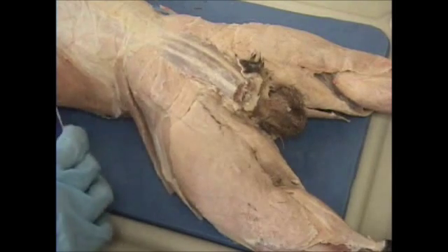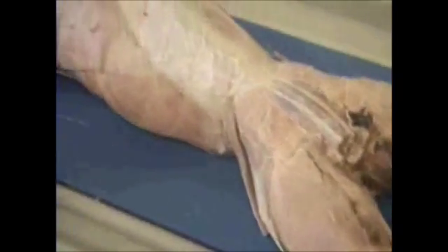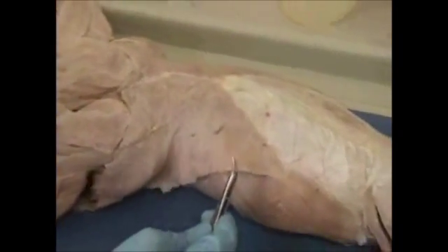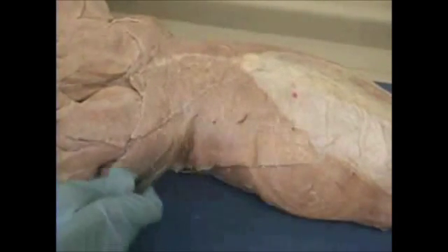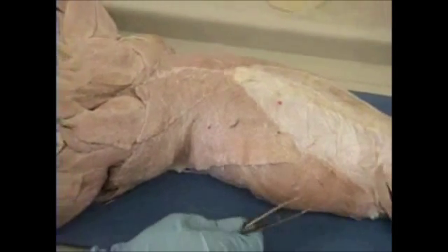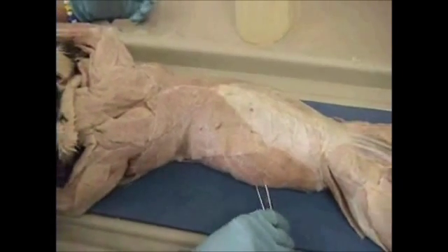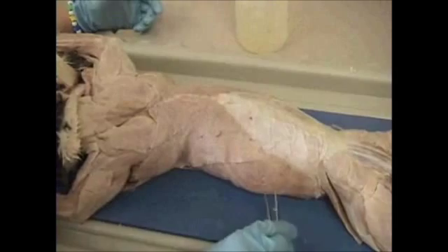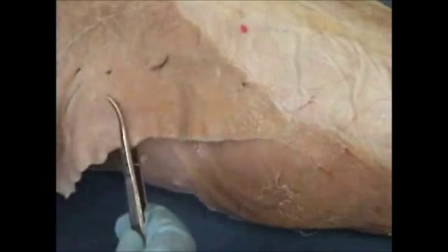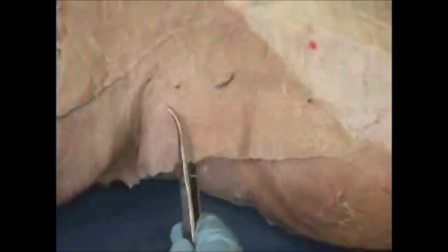Continuing up the back, we have our large back muscle known as our latissimus dorsi. And the other muscle we see with the striations running down is our external oblique. All of this is your external oblique; your back muscle is the latissimus dorsi.